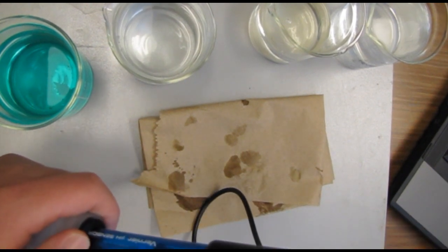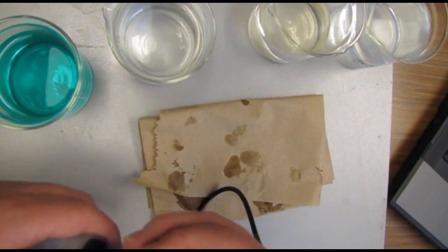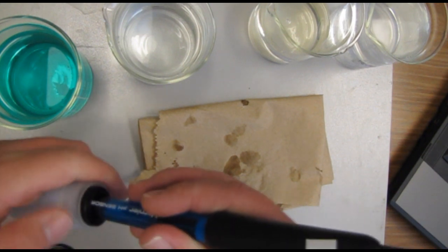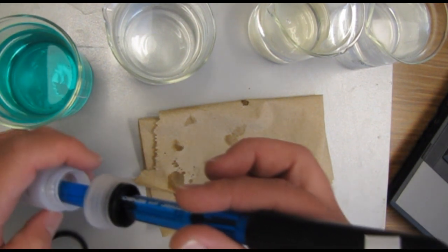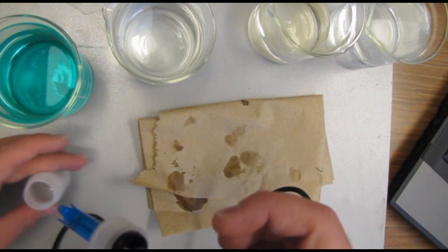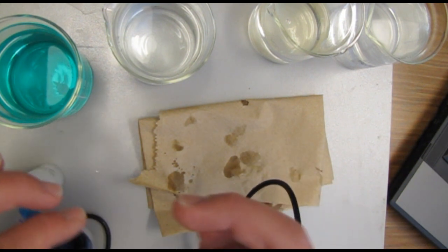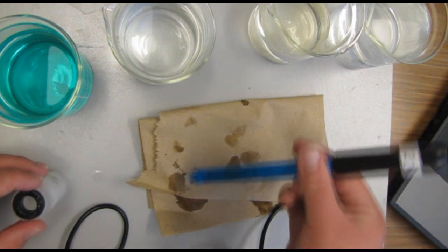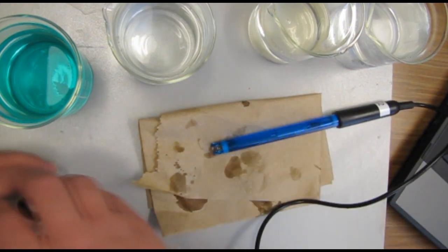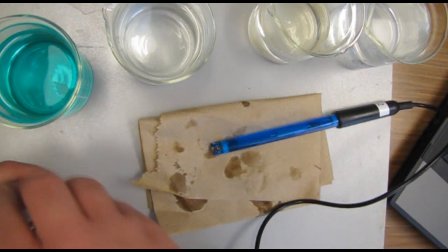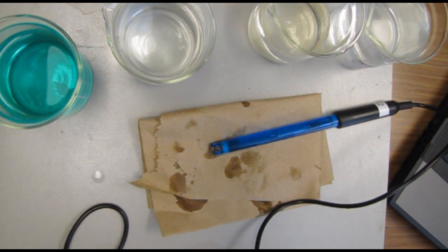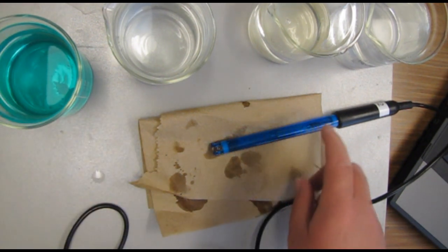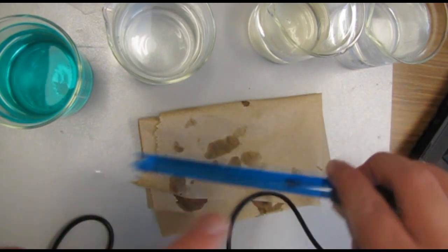Okay, so we have our cap here and we're just going to unscrew it and pull it out with the cap still on, and we will just slide that off and screw that back on. Set that over here so this thing gets wet. Okay, and here is the probe.